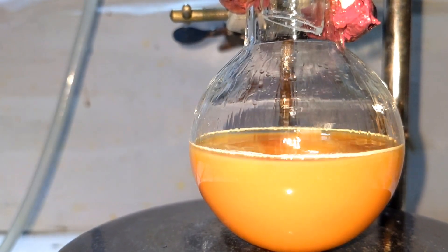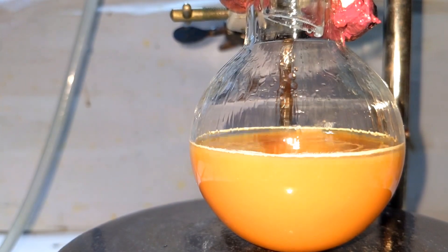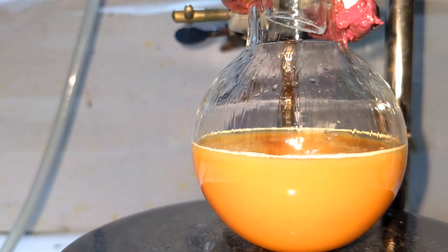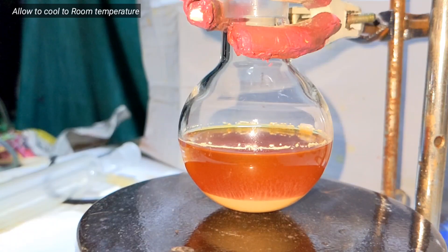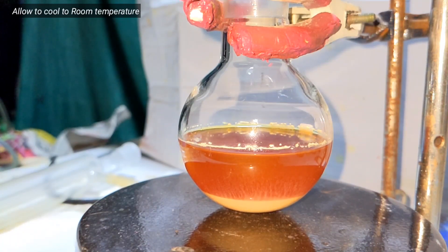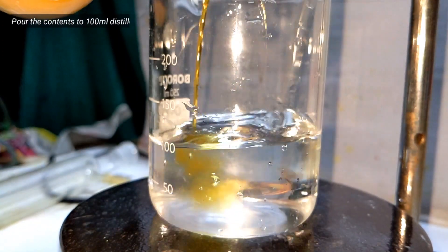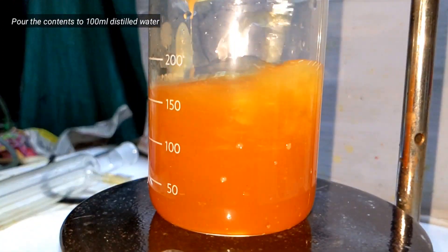After two hours, the reflux was stopped and the mixture was allowed to cool to room temperature. Then the contents of the reaction mixture were poured into 100 milliliters of distilled water and mixed carefully.